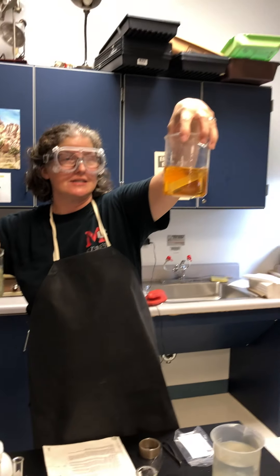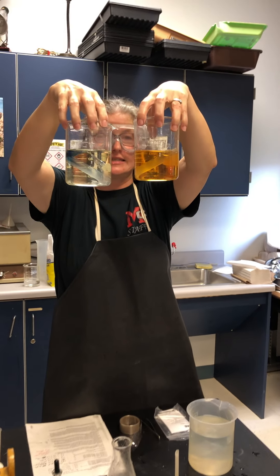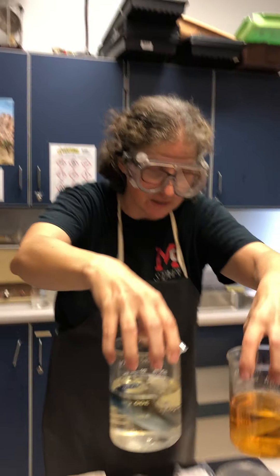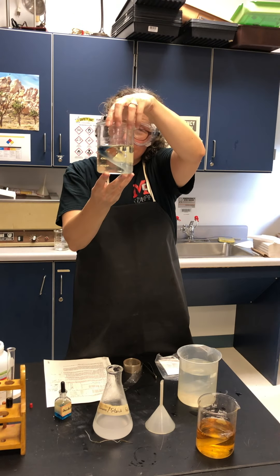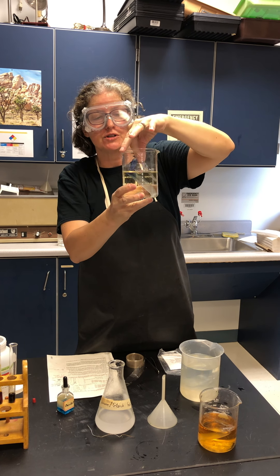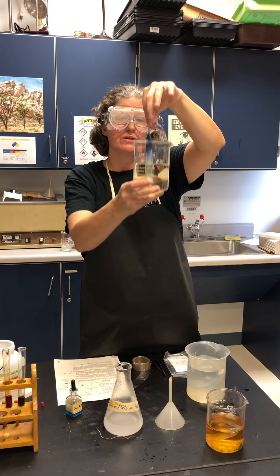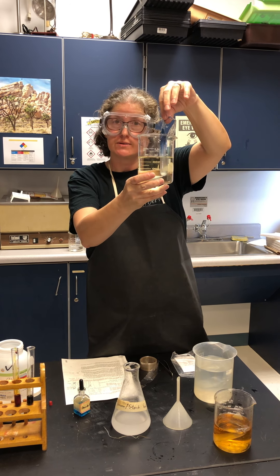There is definitely a difference when this situation has been allowed to sit over time — we have some color changes. First of all, the beaker water is much clearer. And the beaker water does not seem to have turned black. It started orange, and now it's clear.